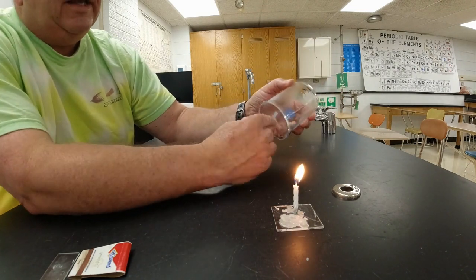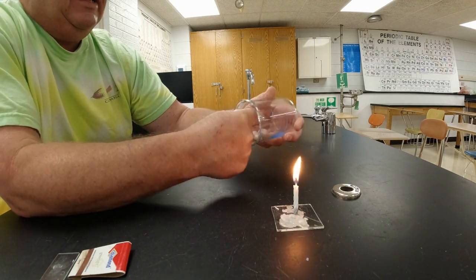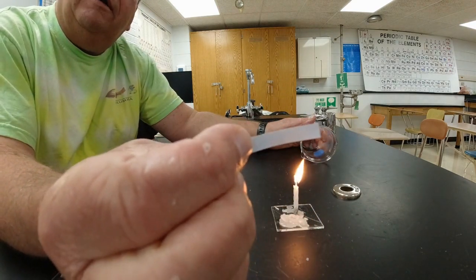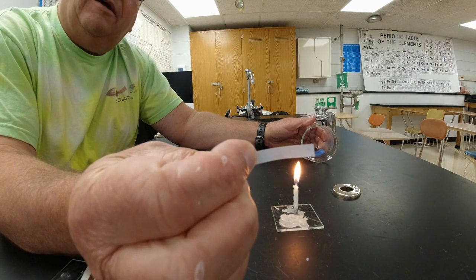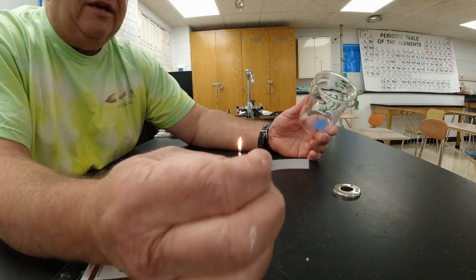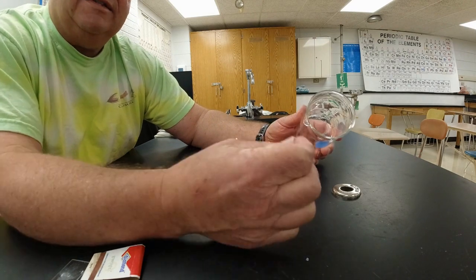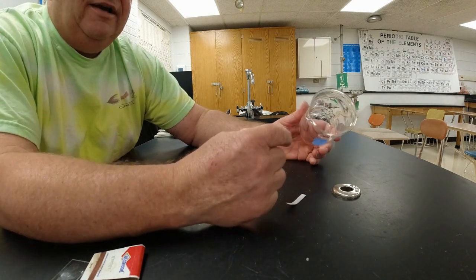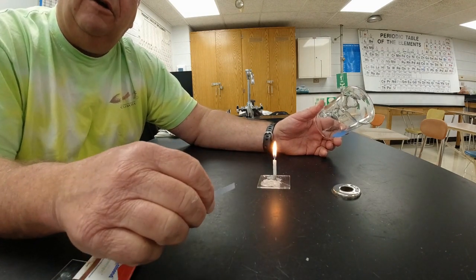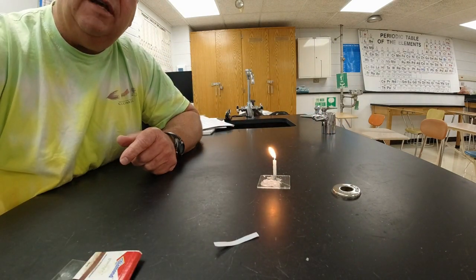So now I'm going to take that cobalt paper and wipe it around in that liquid that's in there. I didn't get much, but one of the things I can see, I don't know if this is going to show up very well or not, is that the cobalt paper is turning pink. Okay, and we don't have the flame close. The cobalt's turning pink, and it's turning pink because what's the liquid in here? What does cobalt paper test for? Since it turned pink, it tells us that the liquid coming off of the candle is a very specific substance. All right, if you need to go back and listen to that again, pause it and write down your answers. This would be a good time to pause.